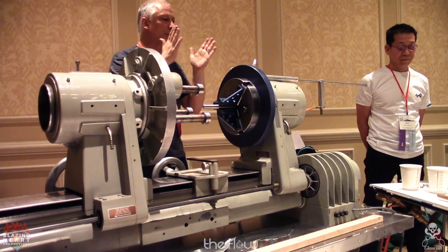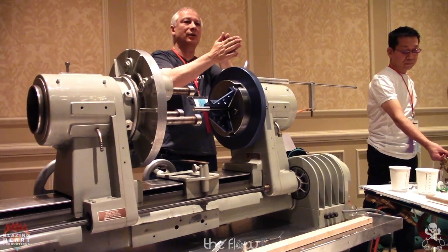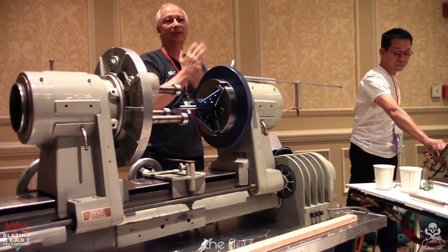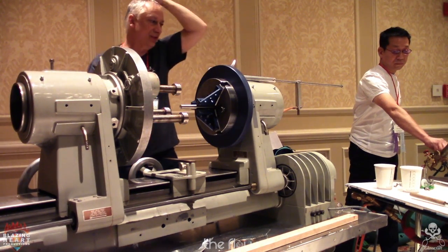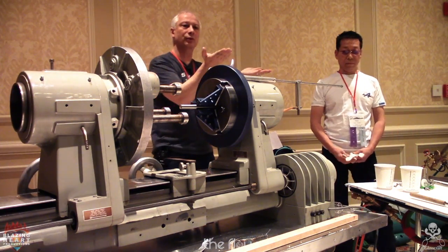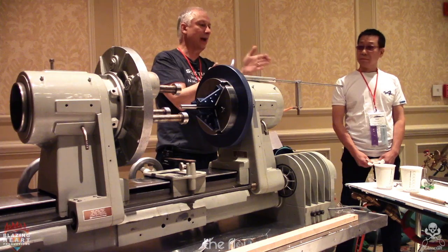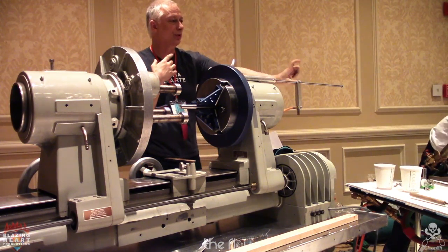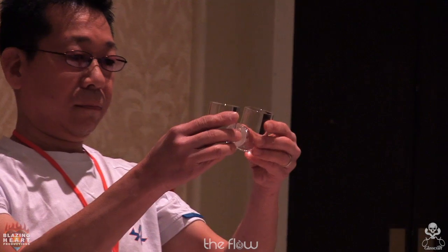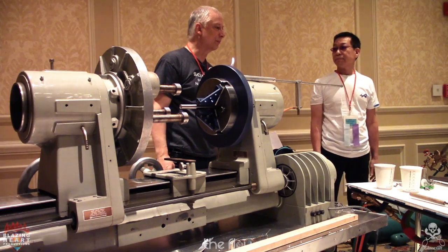The issue is that these are ground flat flanges. There's no O-ring seal on there. They have to mate exactly correct, and if the angles are off, obviously there's going to be fluid leakage. They're supposed to sit on a countertop when in use, so the 90-degree bottoms on the tubes also have to be perfectly perpendicular to the flat flanges. And they're short. So the trick was, how do you seal these together so that when they're finished, you can set them on a table and grab any one out of any box and they will all fit correctly every time? So this is the process he has come up with for how to put these together.